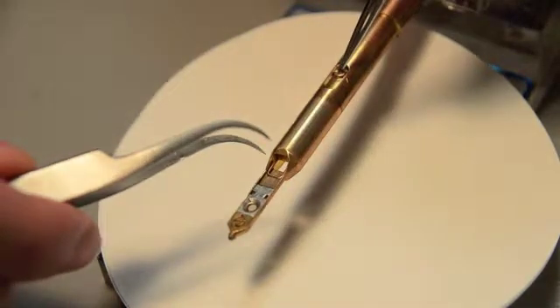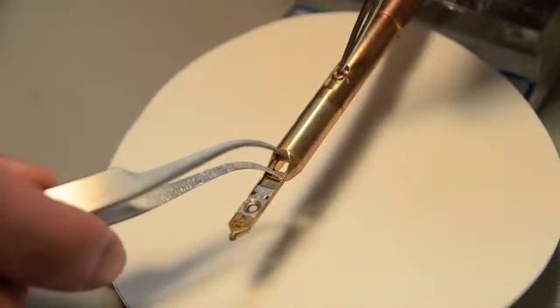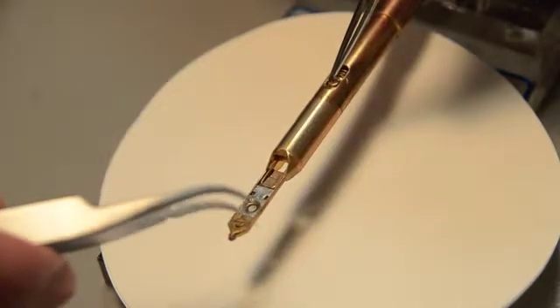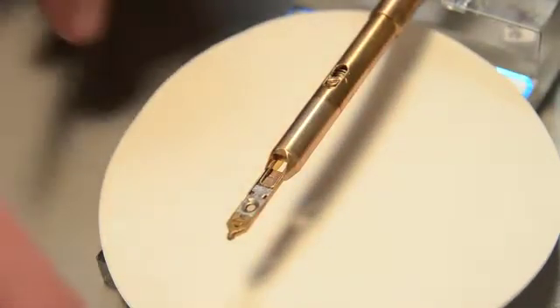Gently pull back on the retaining spring and at the same time lift the retaining loop with a second pair of forceps. Allow the retaining loop to slowly slide toward the aluminum retainer to rest against the edge. Inspect the aluminum retainer carefully and tap the edges to make sure everything is correctly in place.